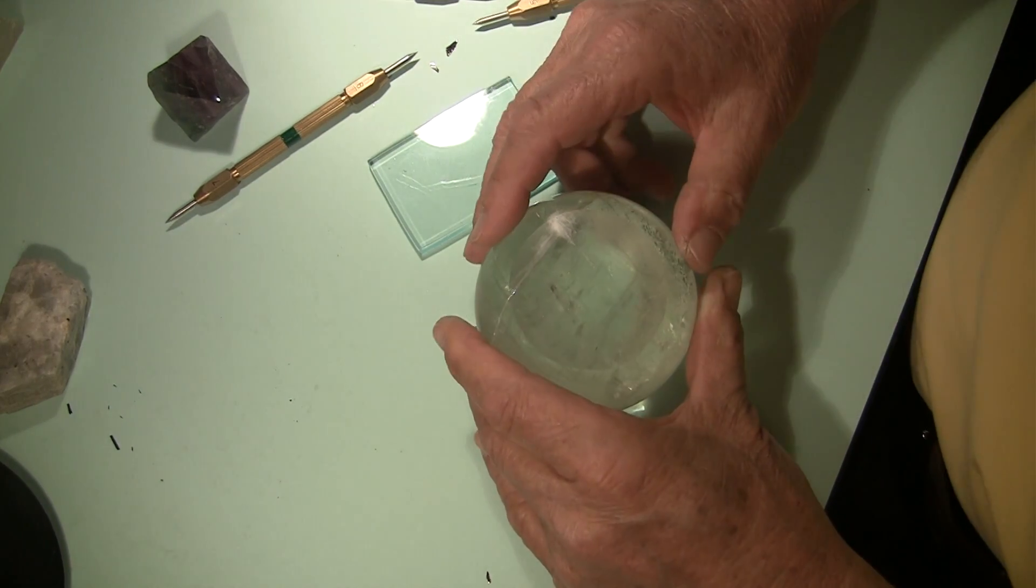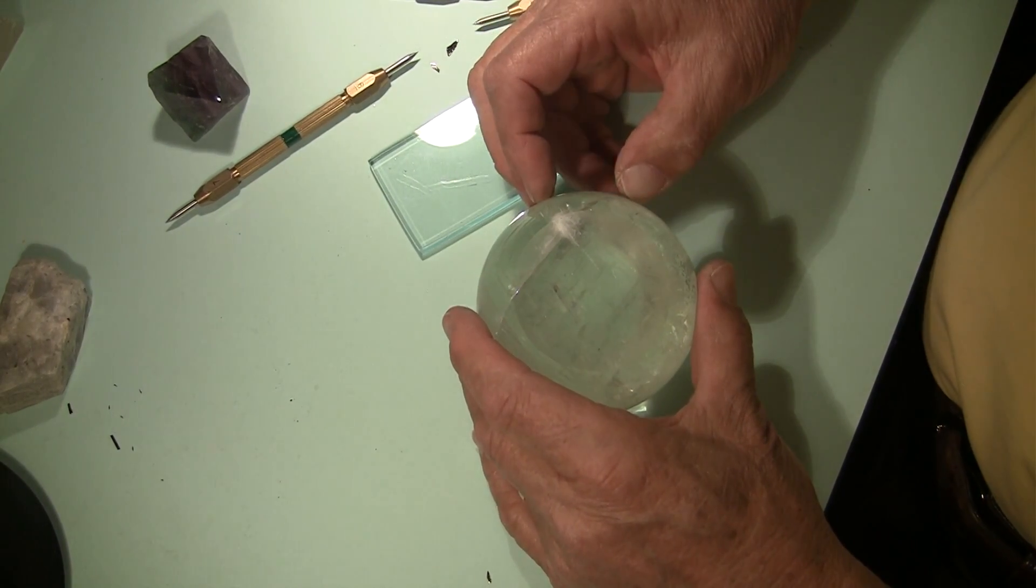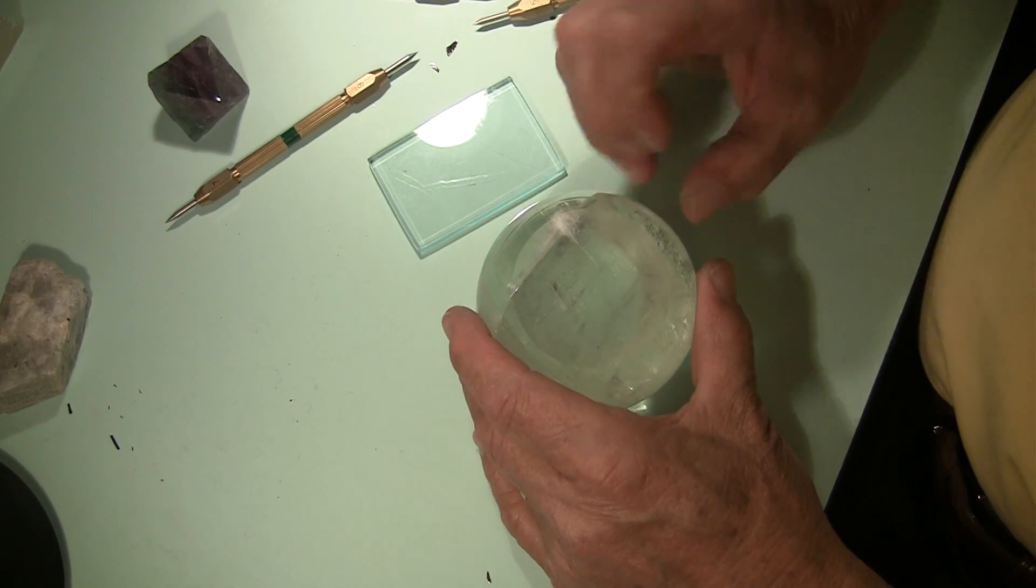My fingernail? No. So the hardness of this mineral is greater than 2.5, maybe 3, and less than 4.